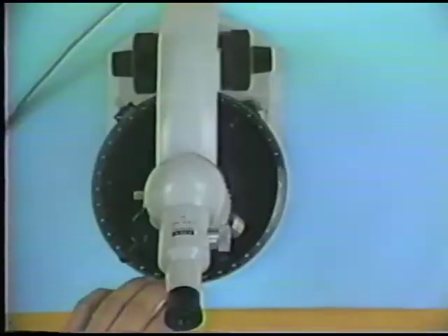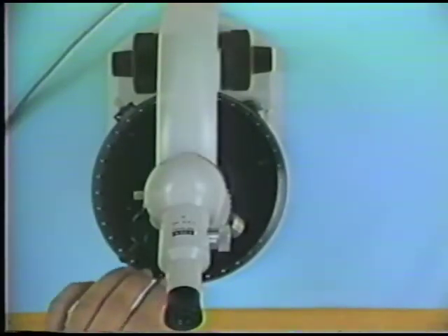And plagioclase, of course, is a very common mineral, in fact the most common mineral in igneous rocks. Twinning is one of the main ways in which we can recognize it, because plagioclase has a very distinctive style of polysynthetic twinning. Other minerals, for example microcline, have another style of twinning which is also highly distinctive and can be used as an identification criterion.